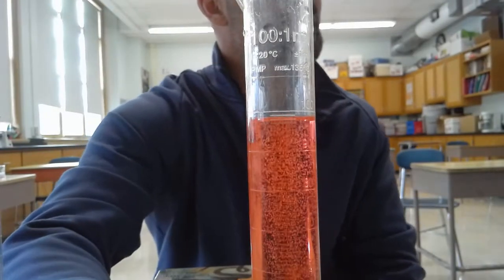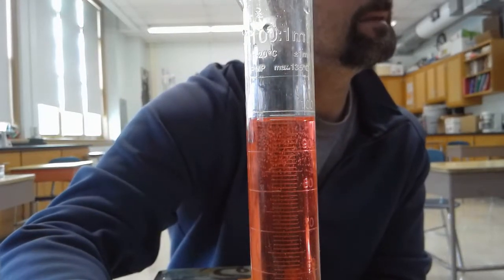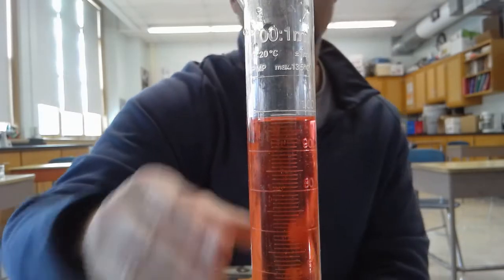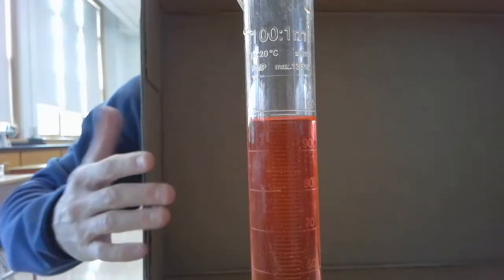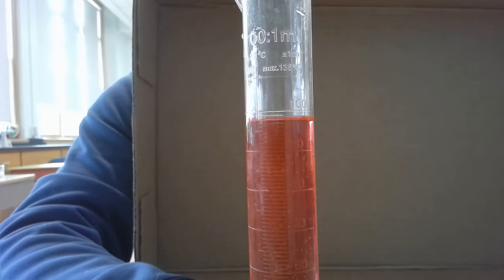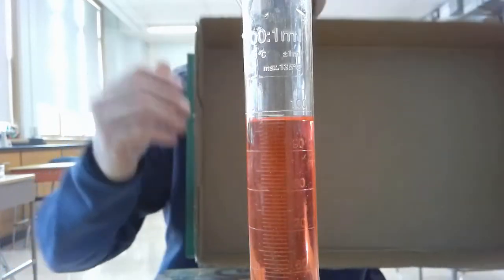What you'll notice is we have less than 100 milliliters, and there's nothing on the stirring rod. When you take a look at the coloring, it's about 97 to 98 milliliters — it actually goes down even more after stirring. So it's around 97.5 to 98 milliliters. Definitely about two milliliters of space are not accounted for.